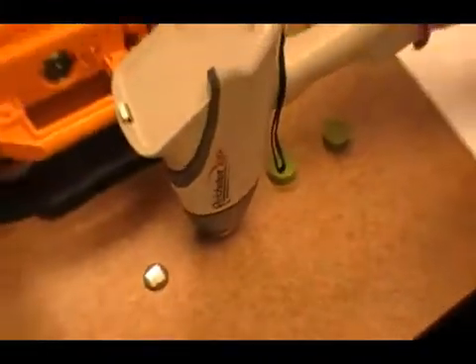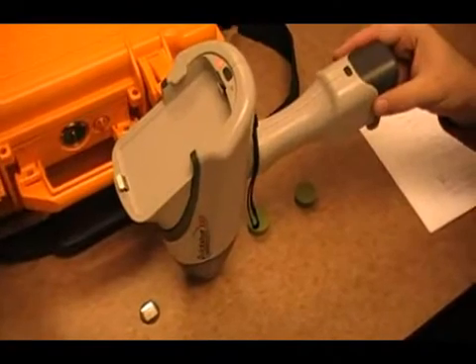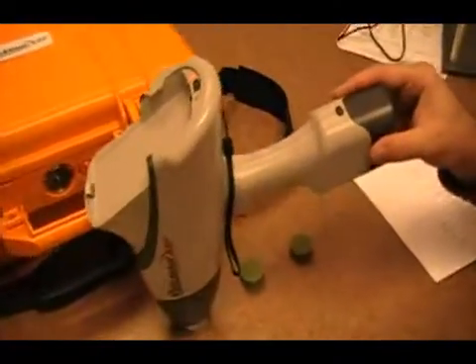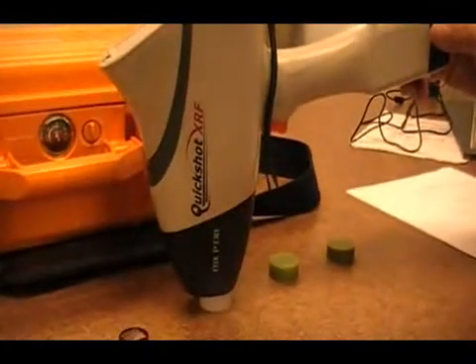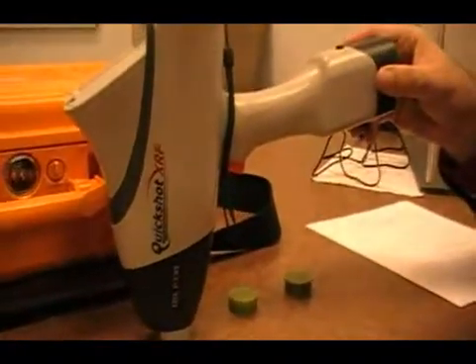Please note that the unit is defaulted to run through the software, not the trigger. As you can see, I'm not even holding the trigger. I currently have my hand on the battery pack, but it is running as you look at the PDA.